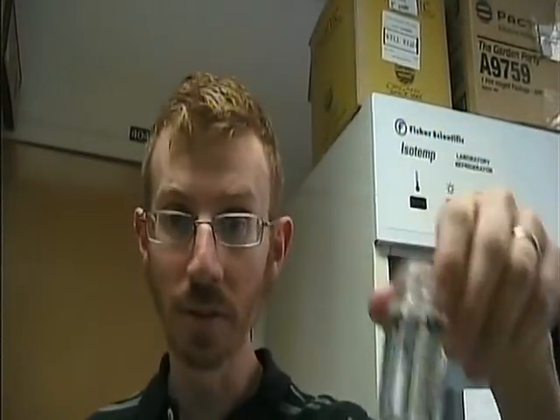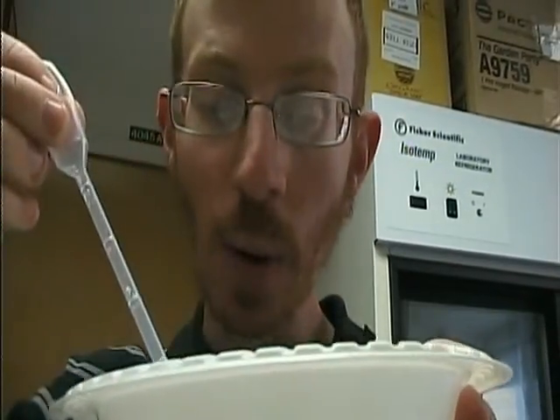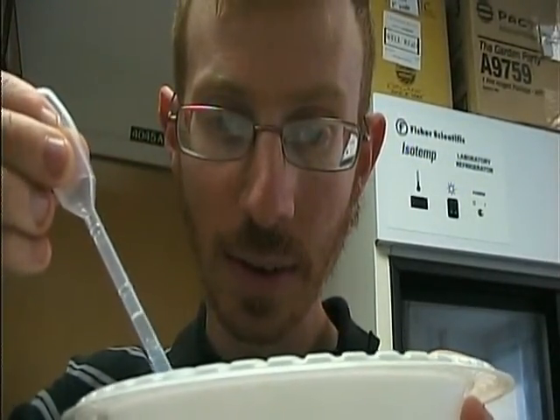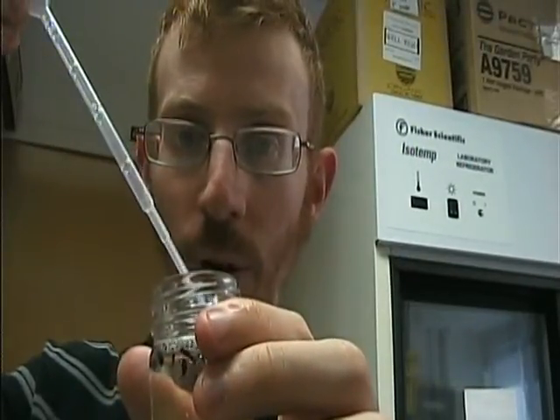You might find that after filling both the first and second vial, you still have a couple of small insects that are difficult to remove — and that's where the small pipette comes into play. Put the pipette right into the bowl above the small insect, fill it up, and transfer the contents directly into the vial. Squeeze the insects into the pipette, push it out, and the small insects will come out.